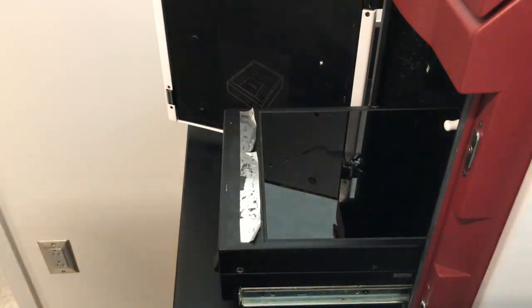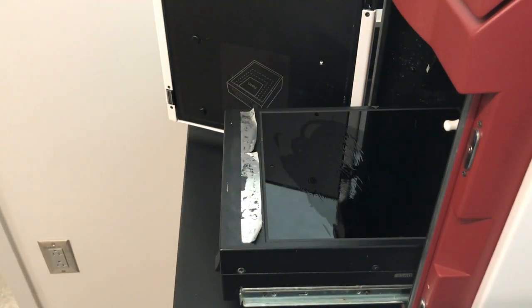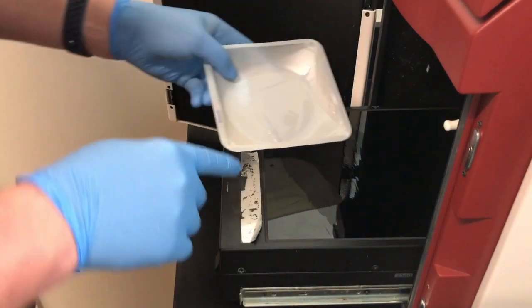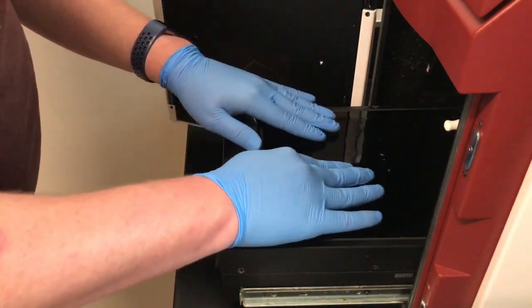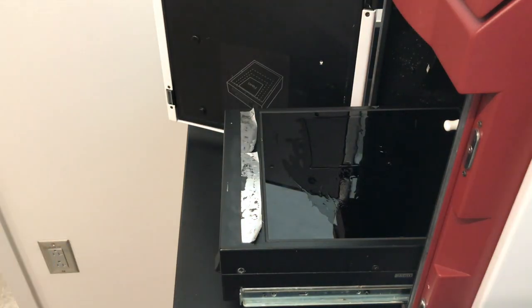Next, we need to get the gels into the gel imager. The TA will probably help you with this because it can be a bit tricky if you don't know what you're doing. These gels are very fragile and they can break very easily.